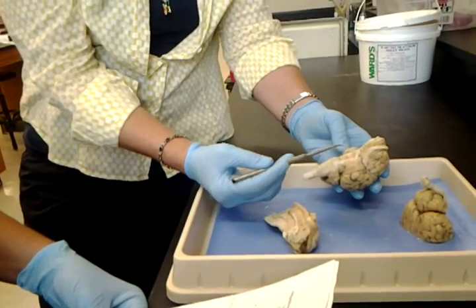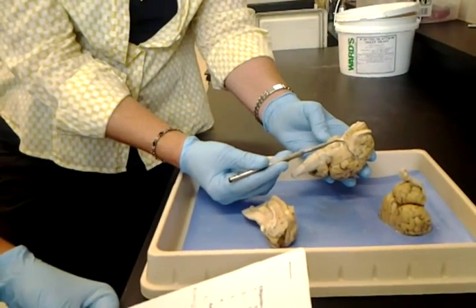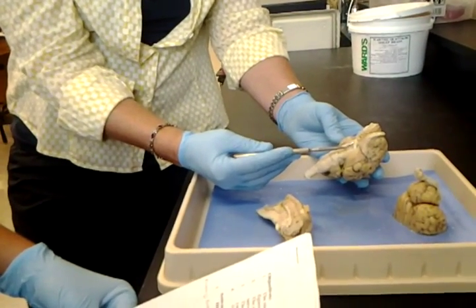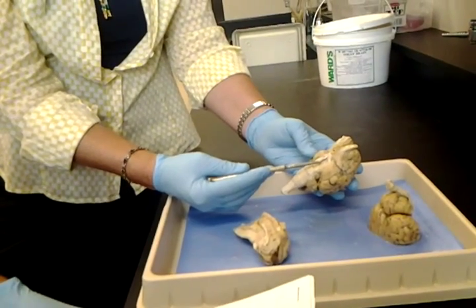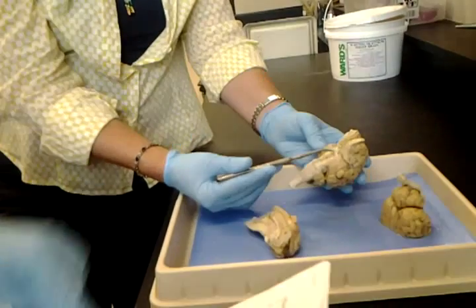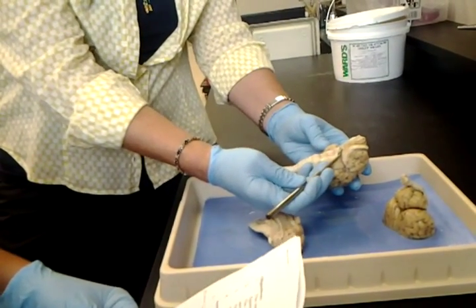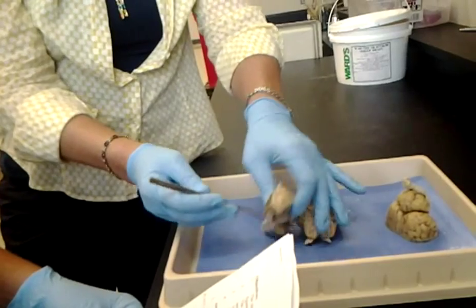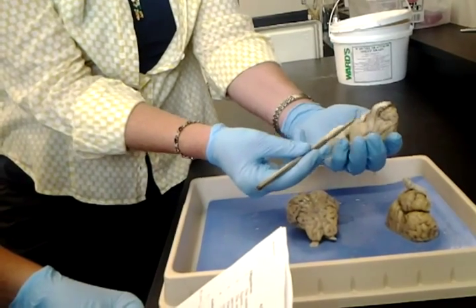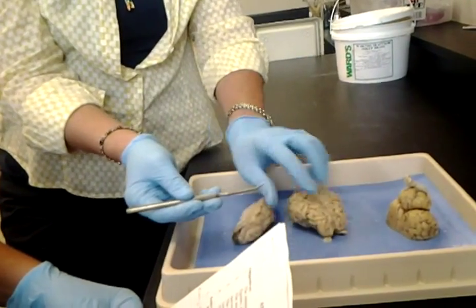Optic nerve. Find the crisscross. This is inferior view. And these stumps are where the optic nerves would leave and go off to the eyes. The X is called the optic chiasm. So if you point it in the middle, we have to know the middle's the chiasm. Really, we don't talk about it too much. Just call this the optic nerve here. They do show it on the PowerPoint from this view. You can see that there's a piece of it. So if you're looking at your book and you see it there, it is there, but it's also shown from this view here.